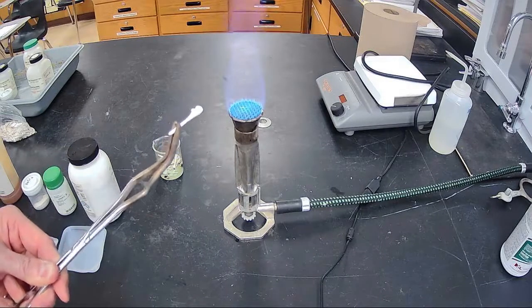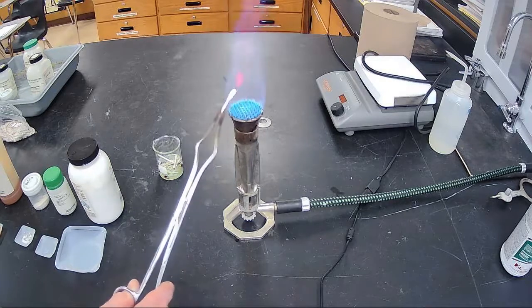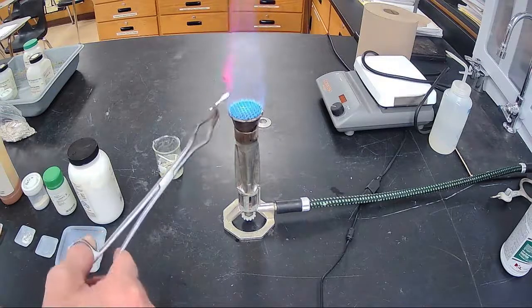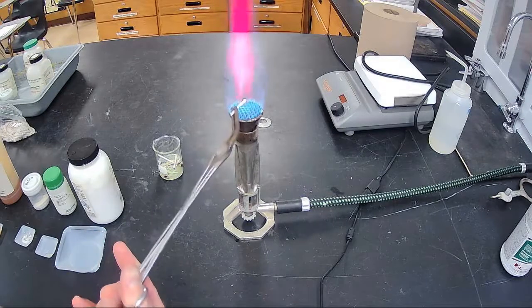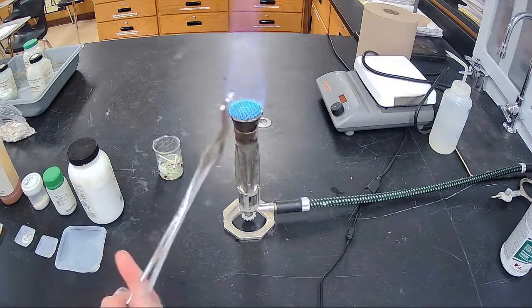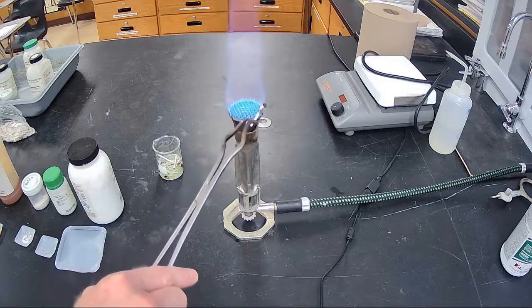Salt crystals, that lump on the end of the Q-tip, the salt crystals are forming. When the water evaporates, all the salt crystals are popping off. So this is number 9, a nice deep dark scarlet red for number 9. So the difference between this one and number 5 is more of an orange red. This one is a deep scarlet red. So 5 again is an orange red, this is a deep scarlet red.